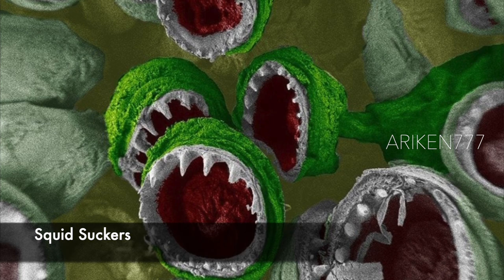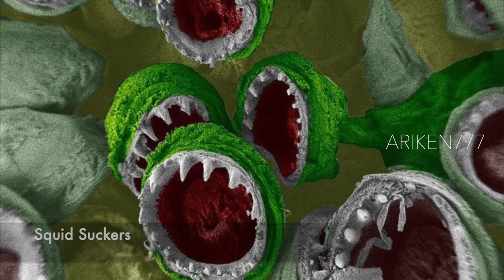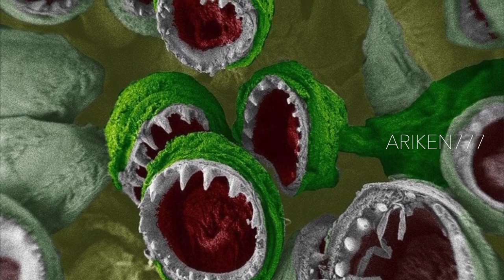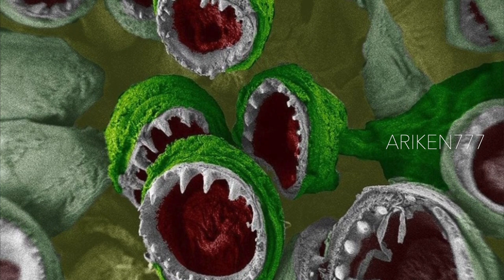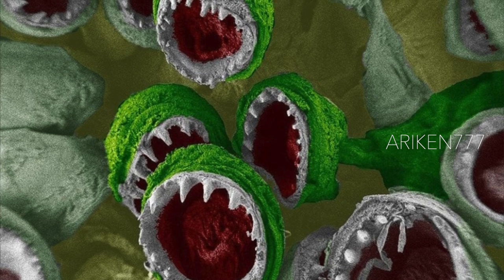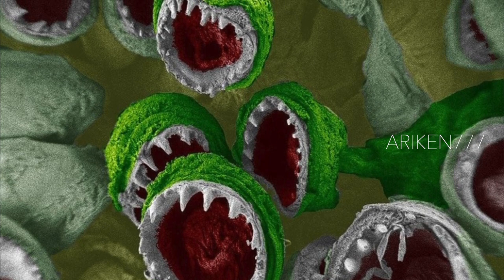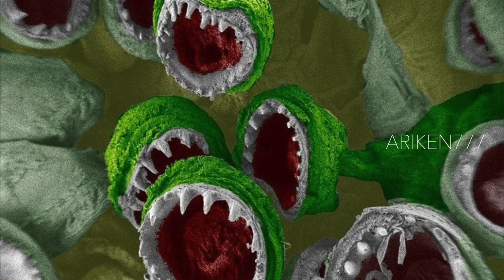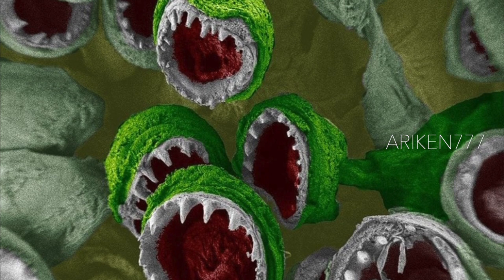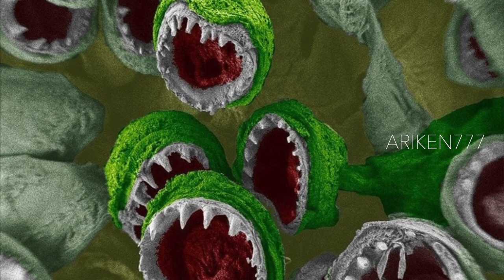These are the suckers of a long-fin inshore squid, which they use to grasp prey. These squids are found in the North Atlantic, schooling in continental shelf and slope waters from Newfoundland to the Gulf of Venezuela. They are commercially exploited and the population makes seasonal migrations that appear to be related to bottom water temperatures.